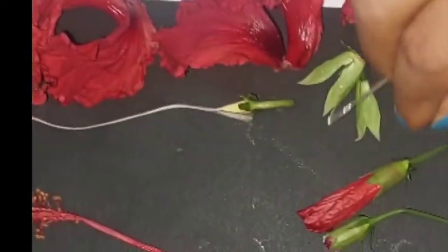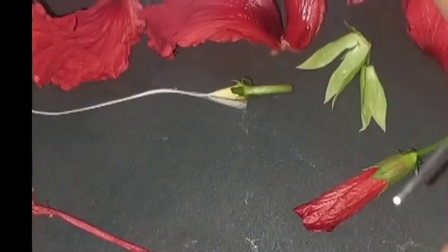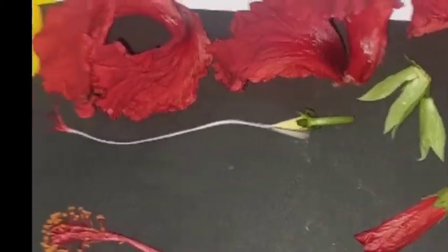Let's find out the pedicel. What are the pedicels? Pedicels are this part which is attached to the plant and this is the sepal. This is pedicel.